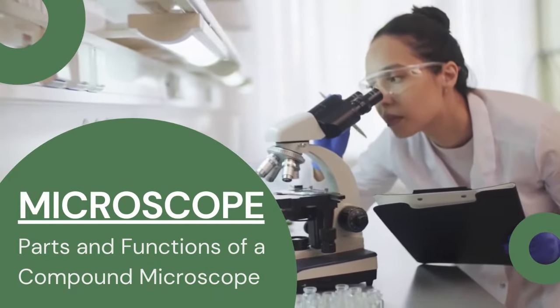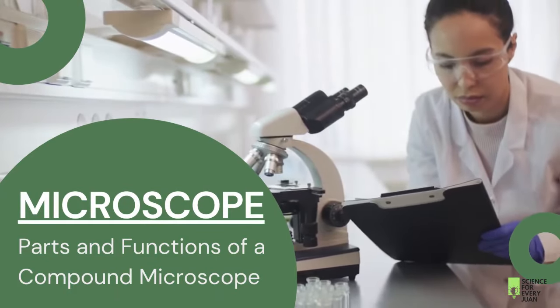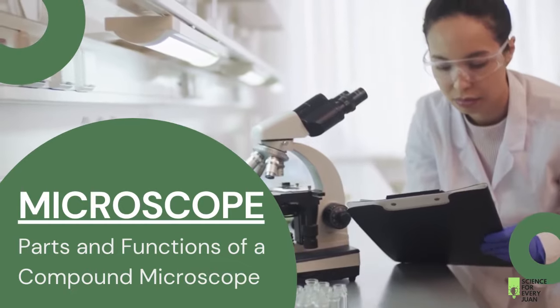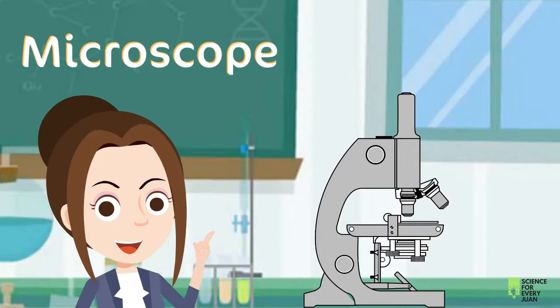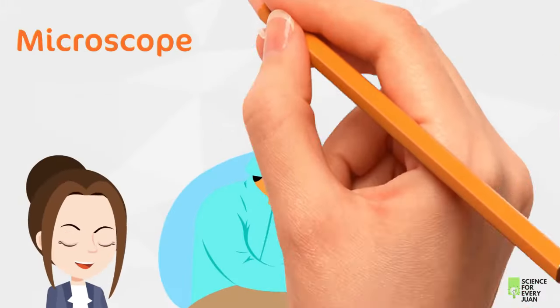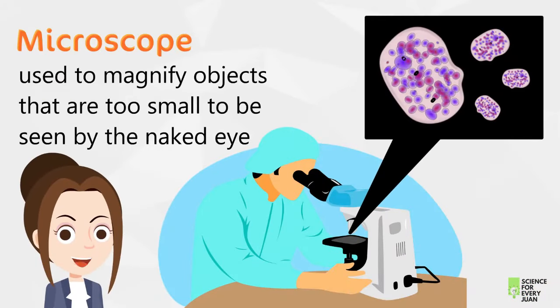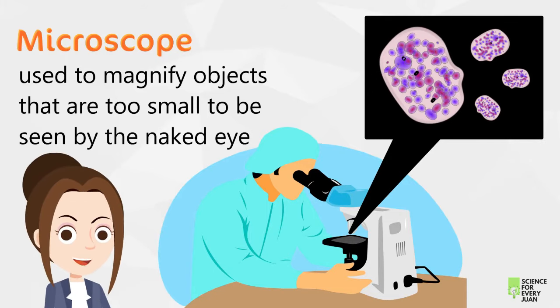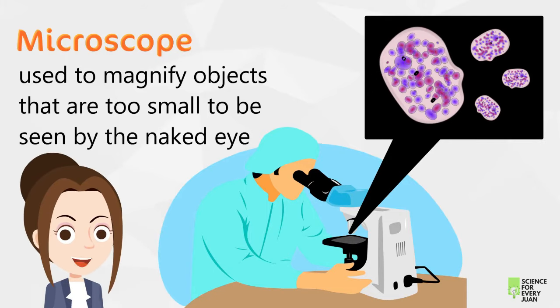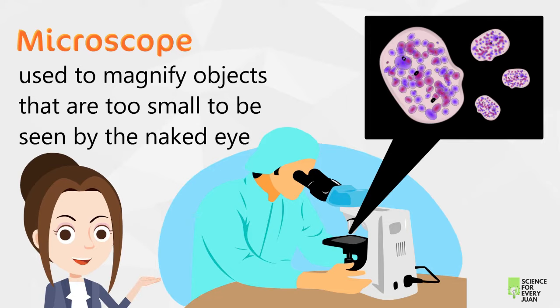Hi everyone, today we're going to learn about the parts and functions of a compound microscope. One of the most indispensable tools in studying biology is a microscope. A microscope is used to magnify objects that are too small to be seen by the naked eye. We use this for studying bacteria and other microorganisms.